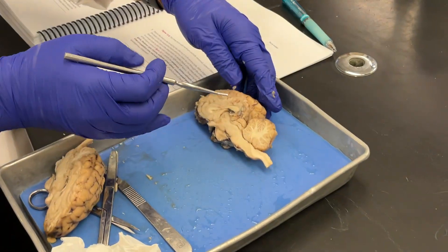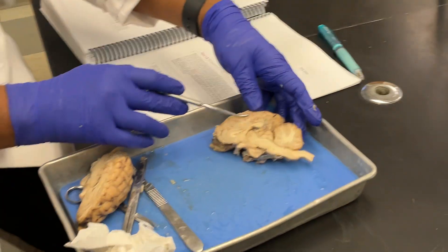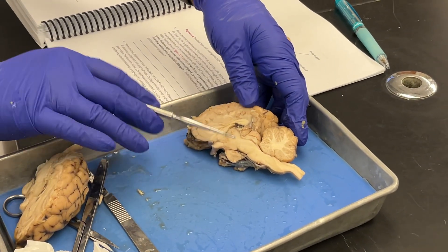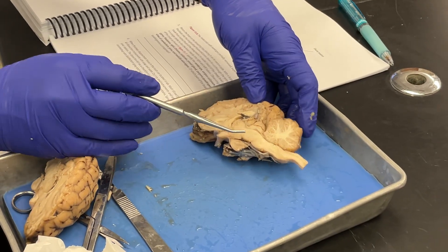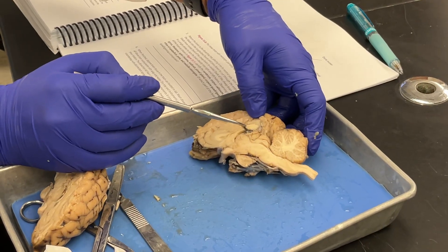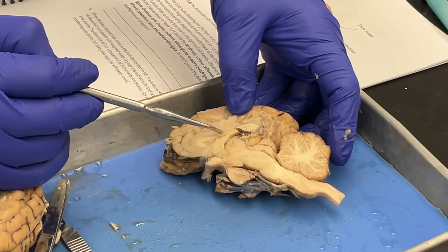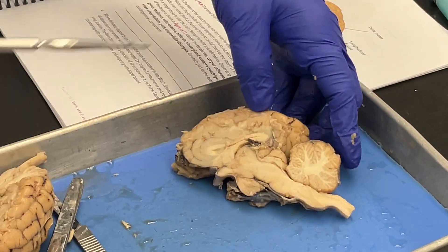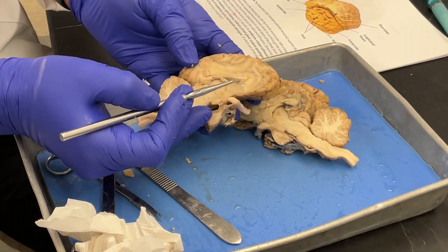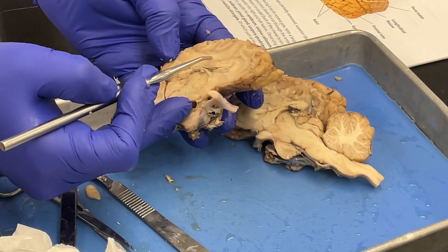We divided the brain into left hemisphere and right hemisphere. This is a sagittal section, and once we do a sagittal section you can see the connection between the left and right side, which is called the corpus callosum. Above the corpus callosum there is a gyrus called the cingulate gyrus.